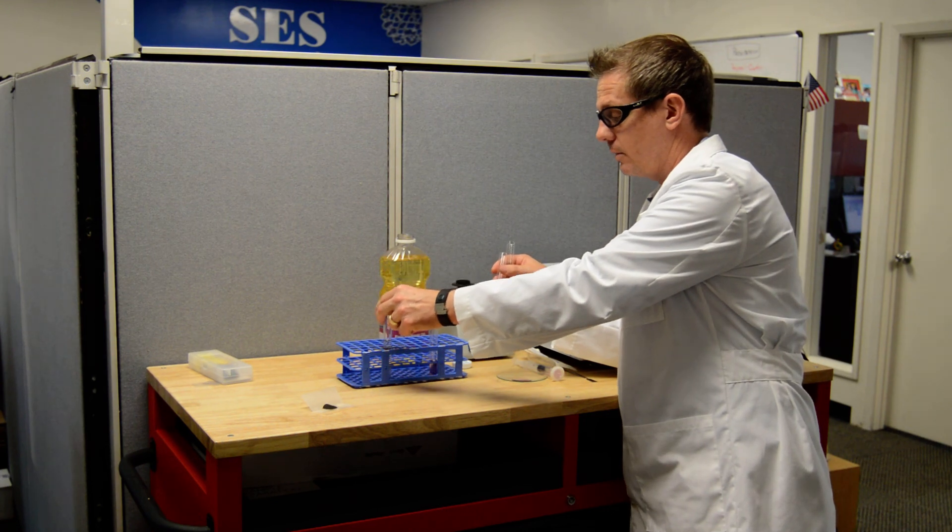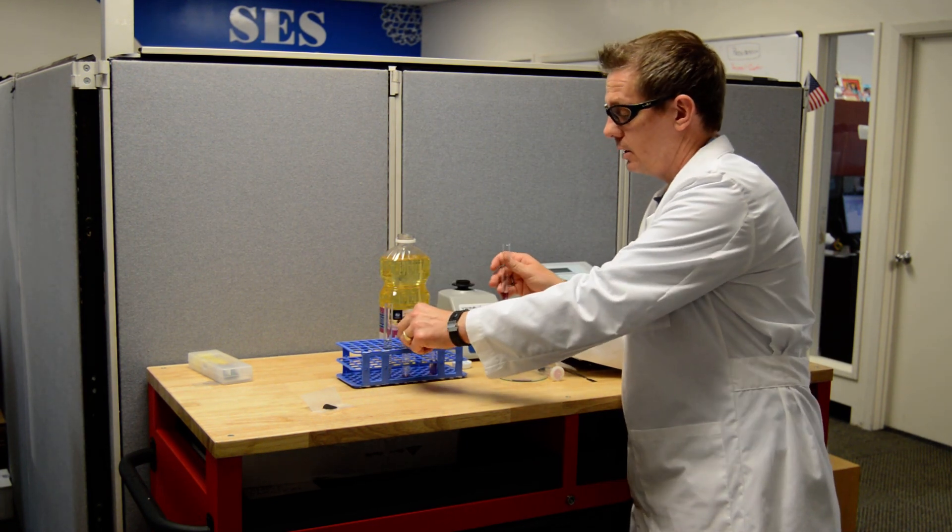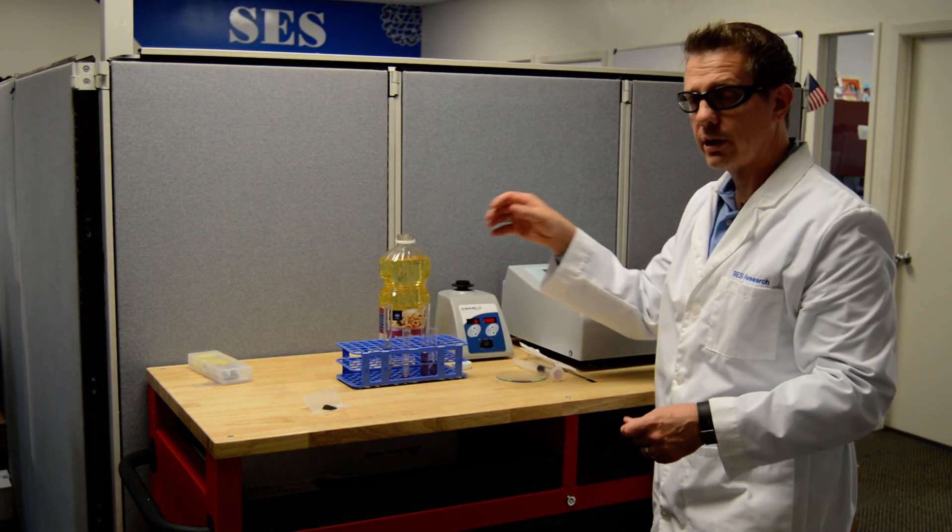So that's our demonstration of filtering C-60 that has been dissolved in sunflower seed oil. Thank you.